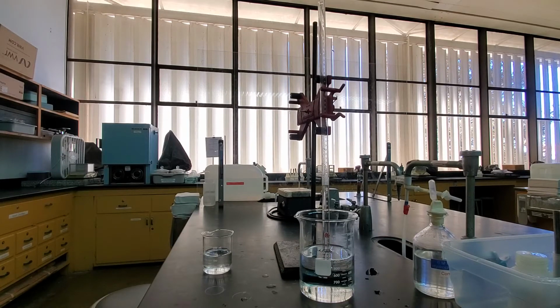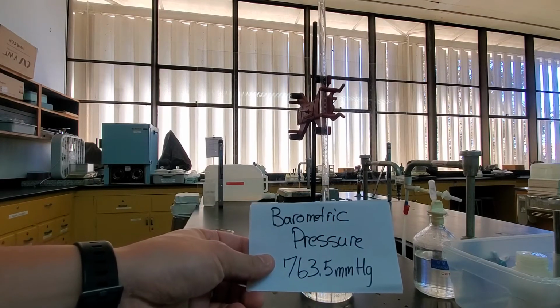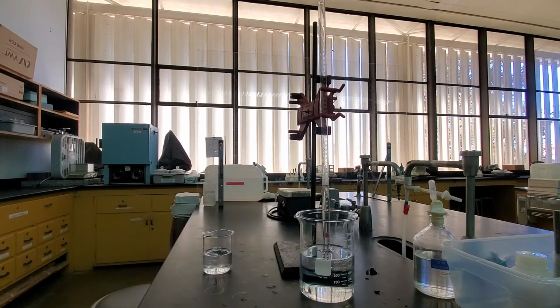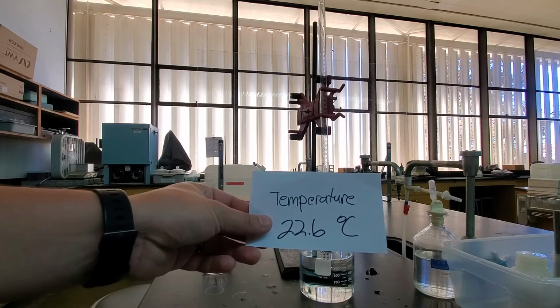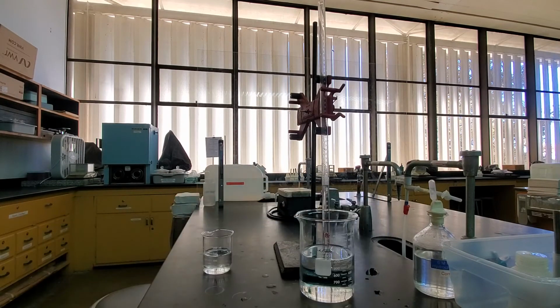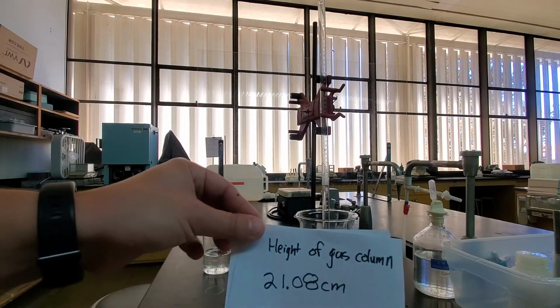There's a conversion in the handout that converts that acid column, its height in centimeters, into a certain amount of pressure that's required to keep it up there. So now we can take our total pressure, which was the atmospheric pressure, this 763.5. We can adjust it with the aqueous pressure, which is what the water vapor at that temperature is related to. And we can subtract from that total pressure the pressure related to the height of that acid column, which we find by looking at the difference between these two.